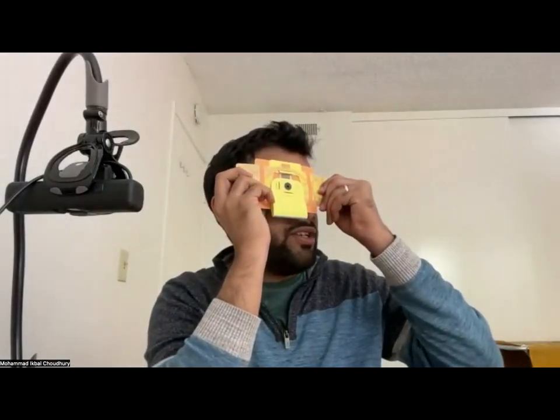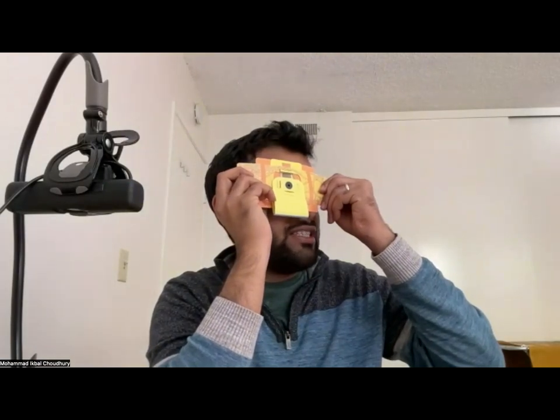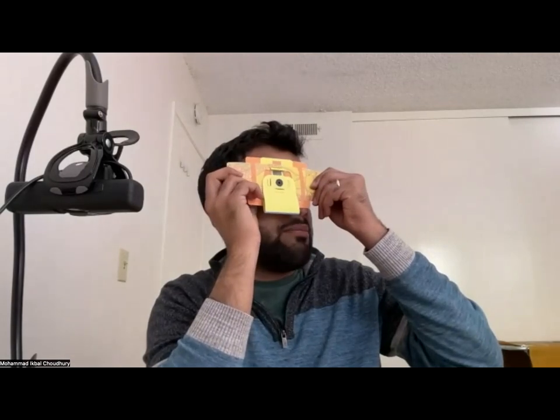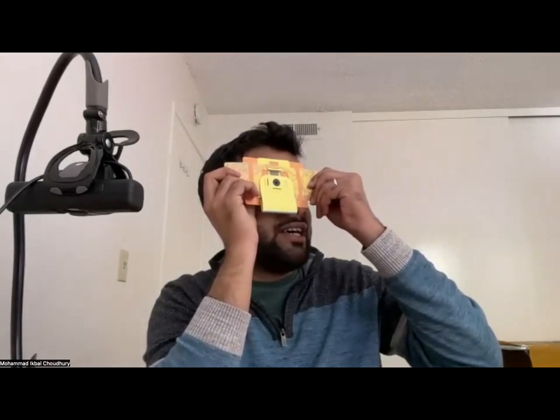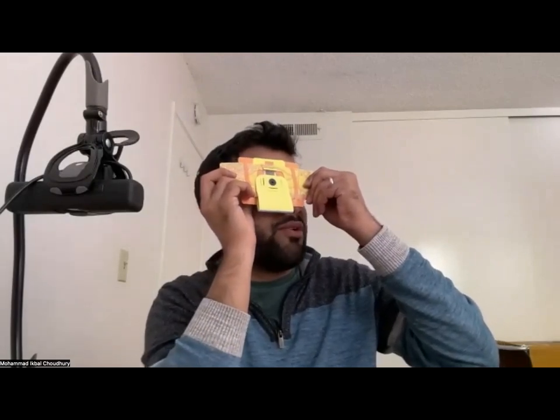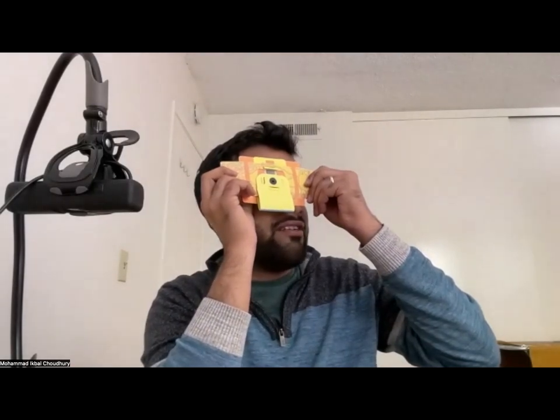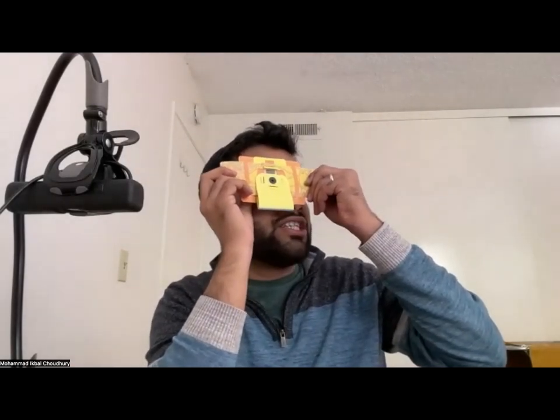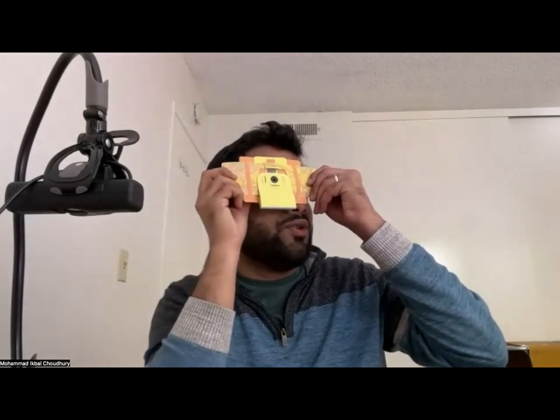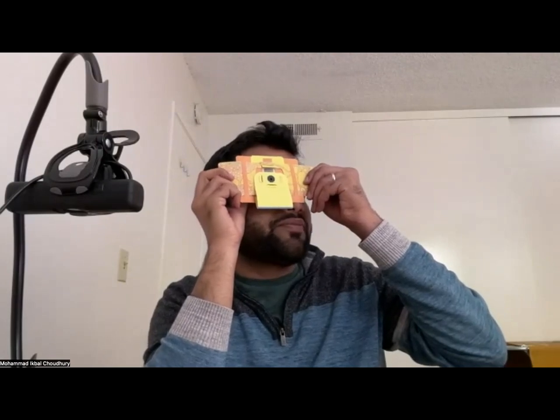So now I'm moving the wedge and I can visualize the sample. If you have a fern rhizome as your sample, then most likely you will be able to see plant cells, which are polygonal, from pentagon to hexagon and more in shape, and they have very sharp boundaries. They're pinkish in color, and I can also move it around to go to the center of the sample to see differences in color and all that. I'm going to show you all of that with my cell phone camera.